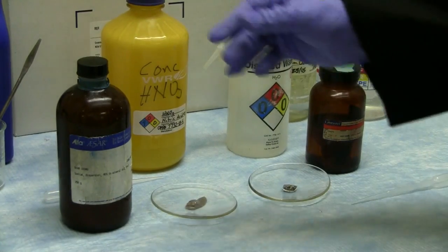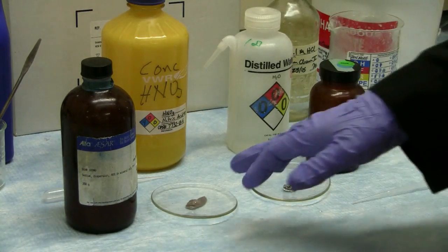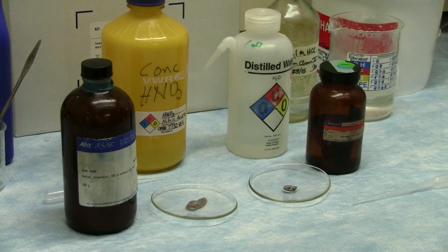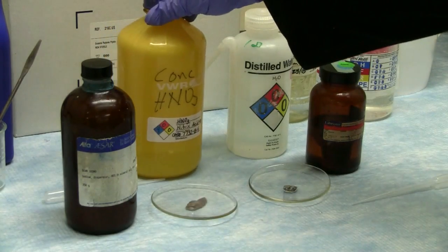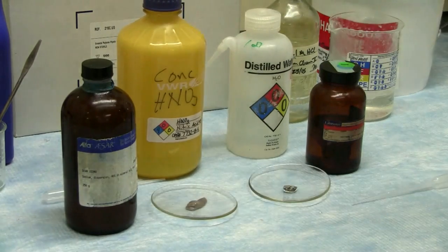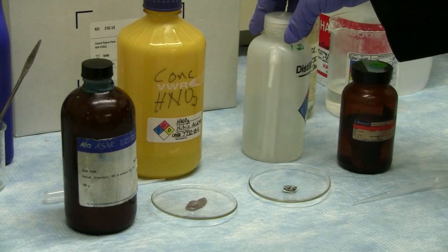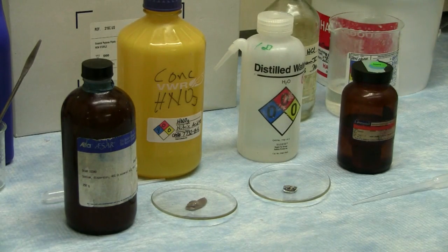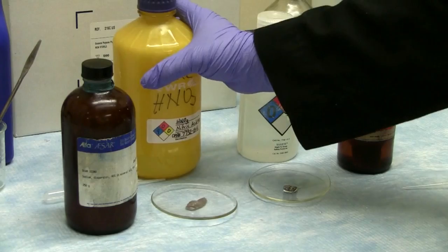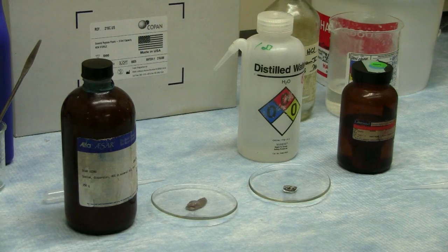Okay, so what we have here, we have a sodium dispersion in mineral oil. To prevent it from reacting with air, I went ahead and put a little bit of sodium on the plate. It still has some residual mineral oil. We're going to react it with nitric acid, so you have a strong reducing agent with a powerful oxidizing agent. And then we are also going to do potassium, which is also in mineral oil, in distilled water. And both of these are going to have a relatively strong oxidation reduction reaction. So the oxidizer is taking electrons and the reducer is donating them.